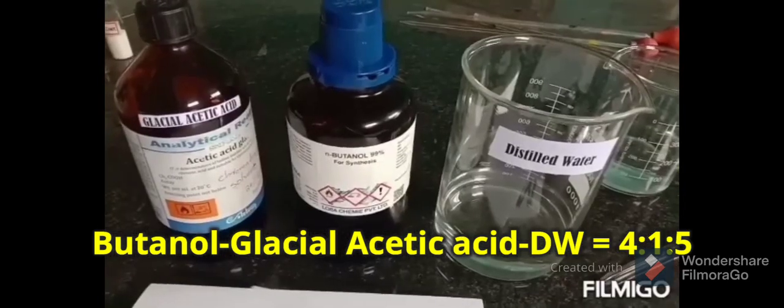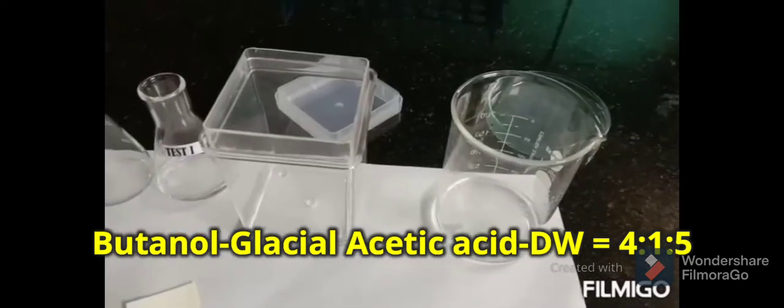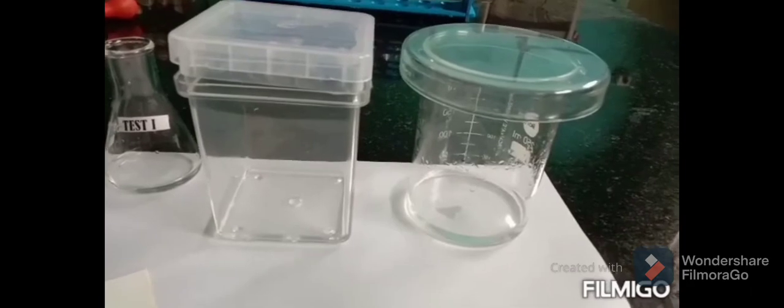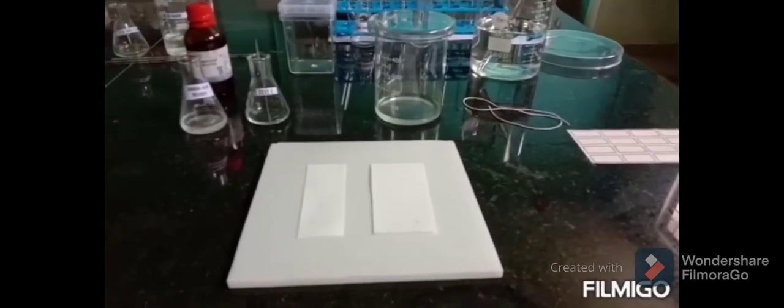The most commonly used solvent mixture for separation of amino acids is butanol–acetic acid–water (BAW) in a ratio of 4:1:5. Alternatively, butanol–pyridine–water in a ratio of 6:6:3 can be used. These solvent mixtures provide a range of polarities. The mixture is added to the chromatography chamber, which is kept closed for some time for vapor homogenization.